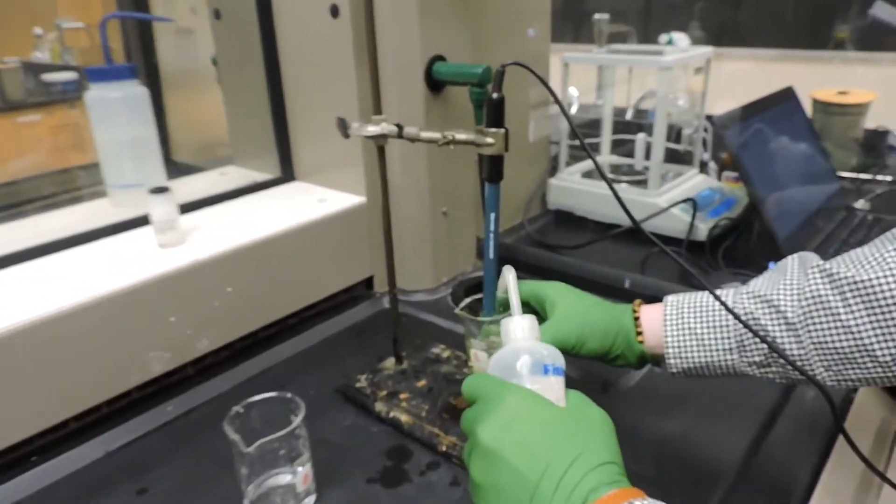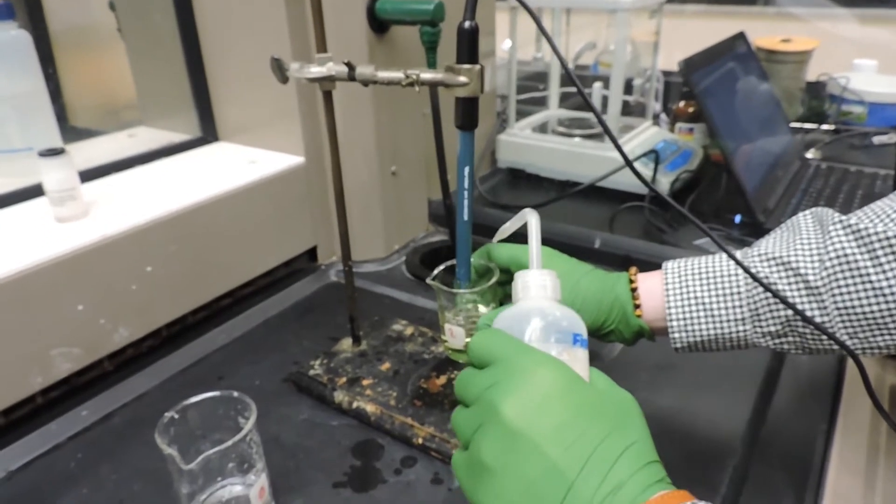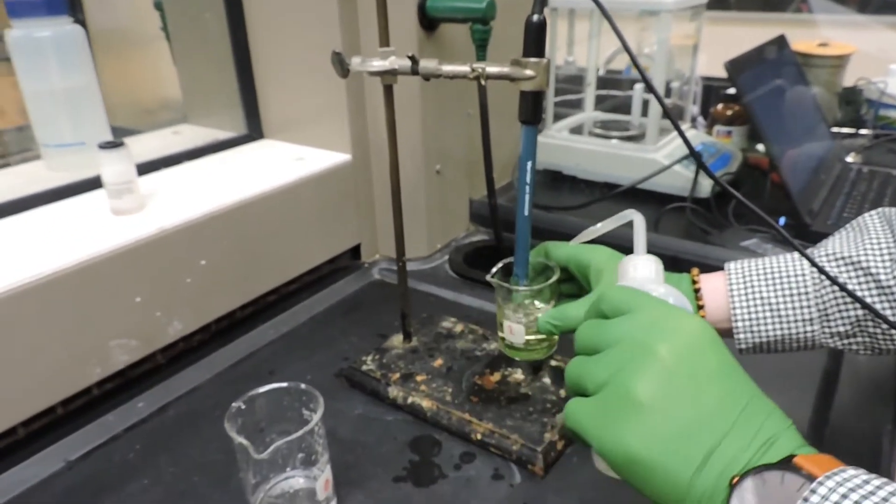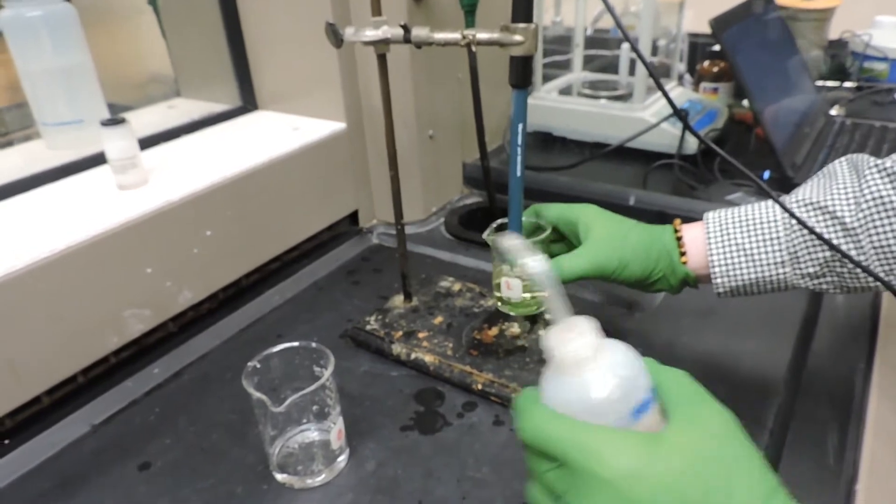It's important to rinse the pH probe with DI water in between every reading so that we don't have any leftover solution on our probe.